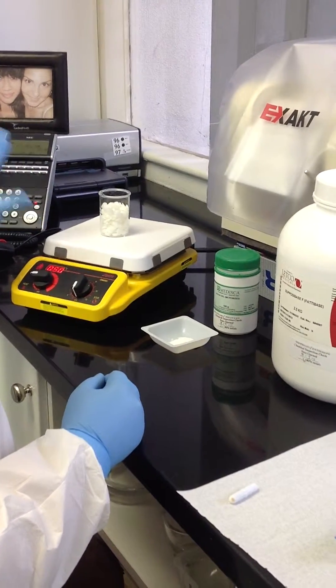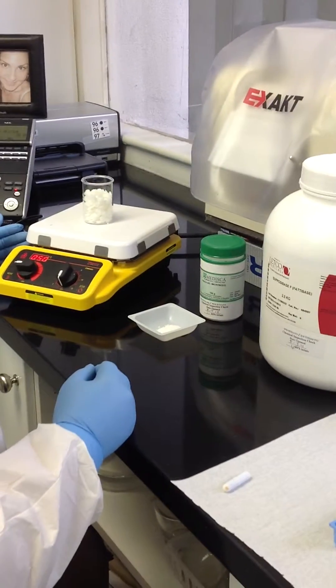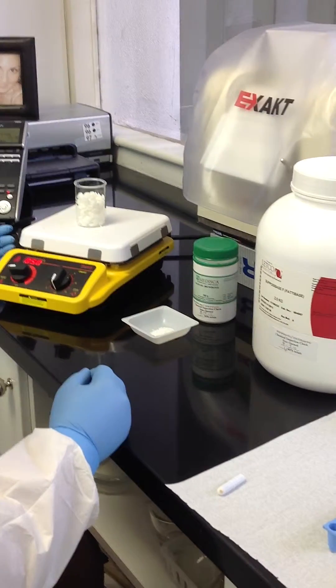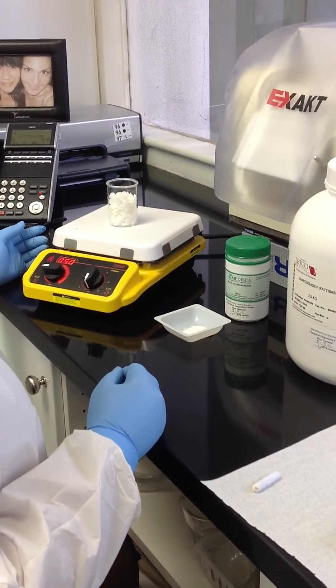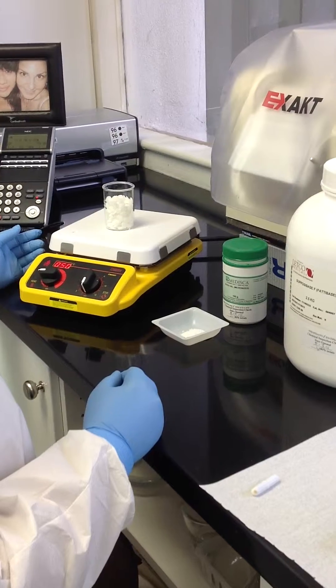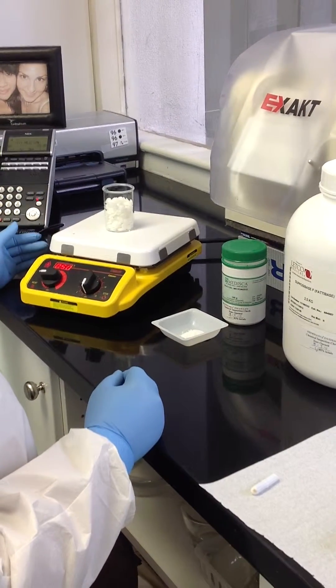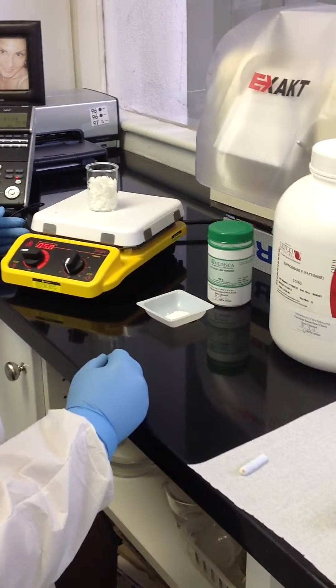Another technique you can use to melt this more evenly is a water bath, but we typically don't use that. We just allow it time to melt and it's fine.